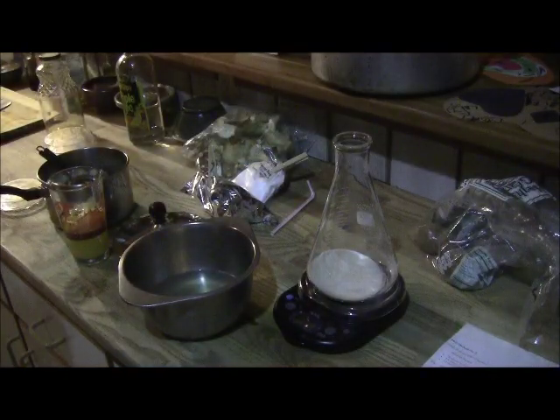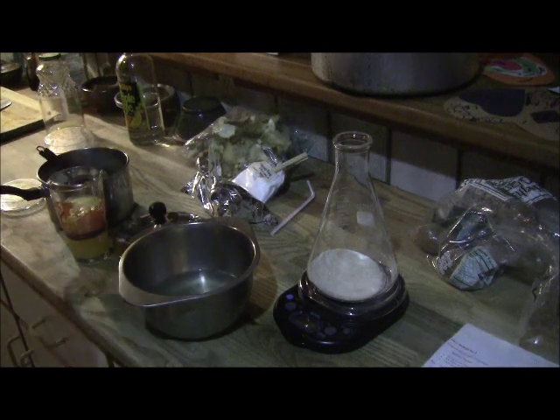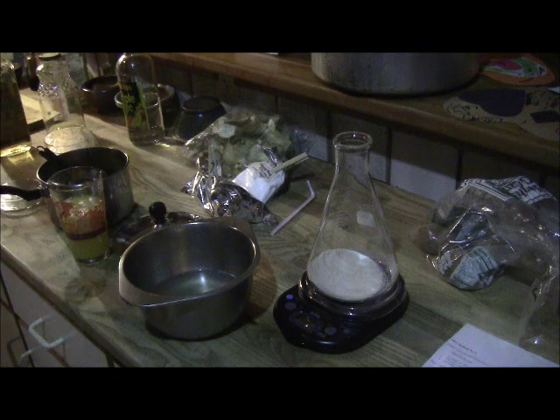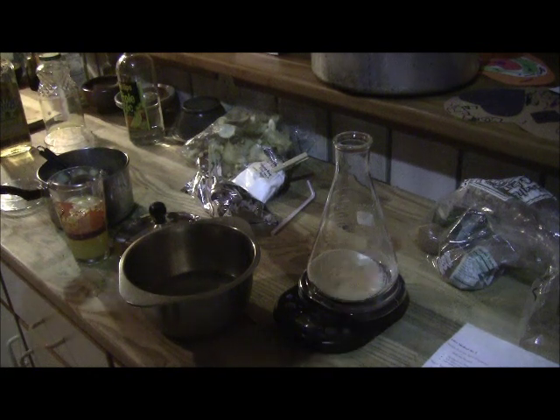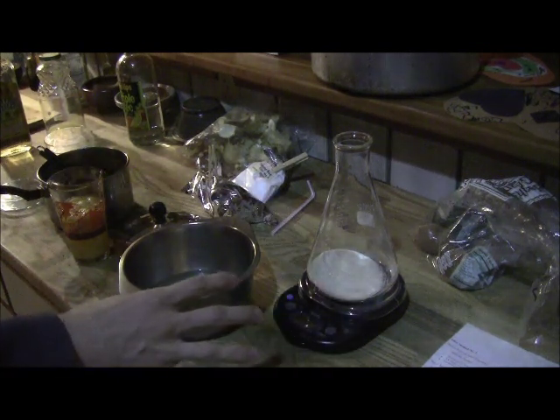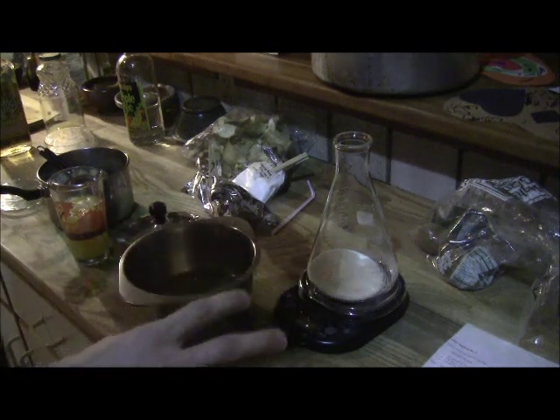It's been quite a while, and I was inspired to make some PDA for petri dishes. This is a pretty quick process, so I thought I'd share it. There are three ingredients that go into the agar you're making for your petri dishes. The first is potatoes — you measure those out — and I'll go through the recipe quickly, but first let me give you an overview.